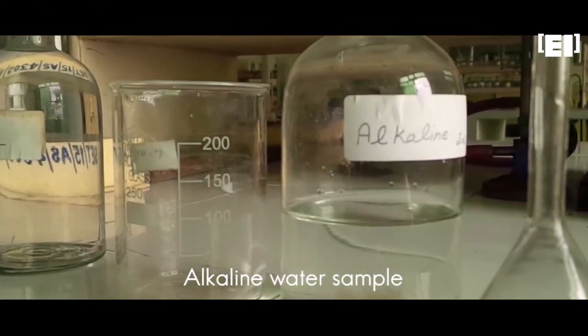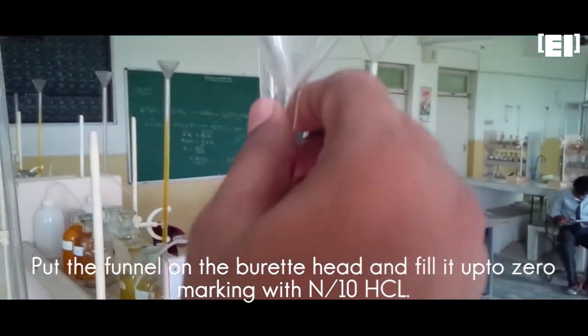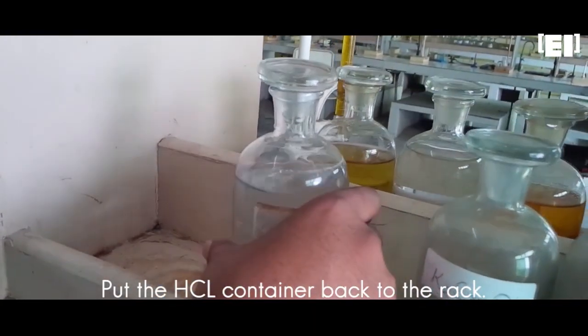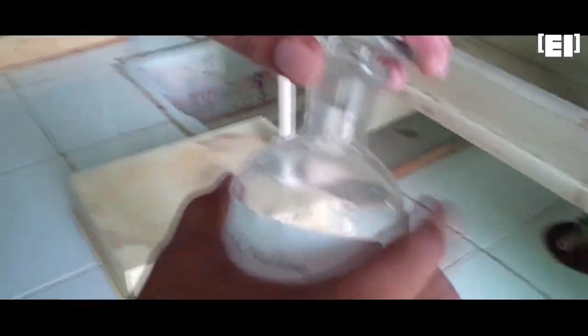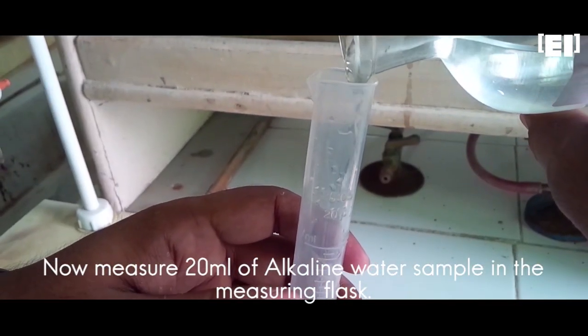We'll need alkaline water sample, beaker, funnel, N/10 HCl, conical flask, measuring cylinder, phenolphthalein and methyl orange indicators. Put the funnel on the burette's head and fill it up to 0 marking with N/10 HCl. Remove the funnel and put the HCl container back to the rack. Now measure 20 ml of alkaline water sample and pour it into the conical flask.